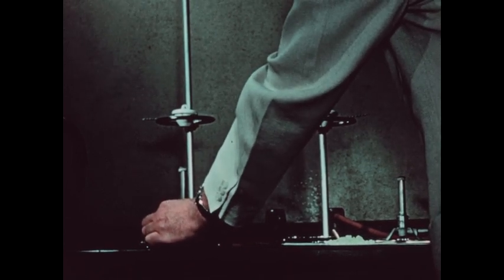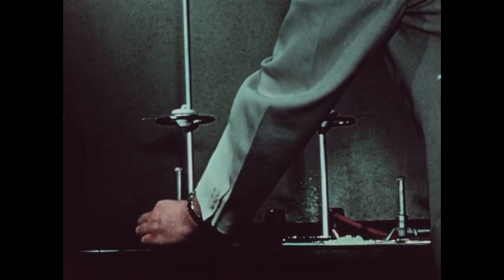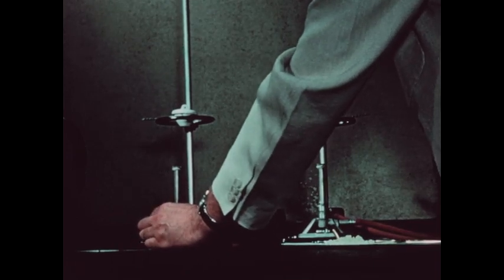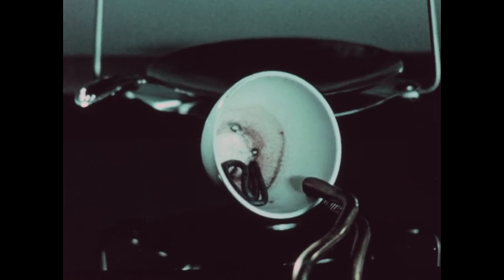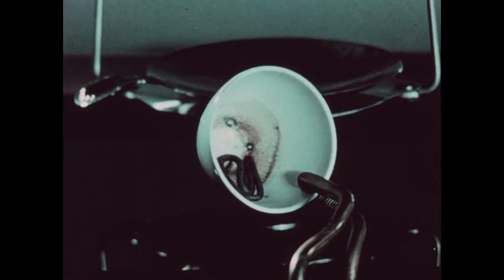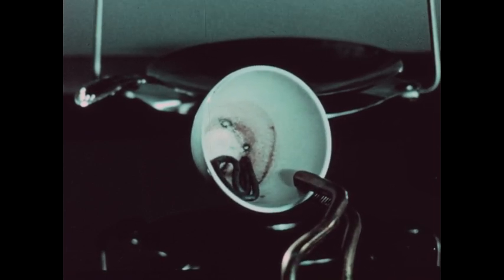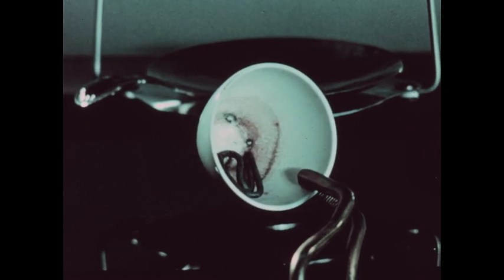We're performing this experiment in a hood because we're going to form rather large amounts of sulfur dioxide gas, which is not pleasant in an unventilated room. The crucible containing the copper and sulfur was heated for 10 minutes, then permitted to cool. Additional sulfur was added and the contents were again heated for 10 minutes. The material in the crucible now has the appearance of a black substance retaining the shape of the original copper wire, though it is now brittle.